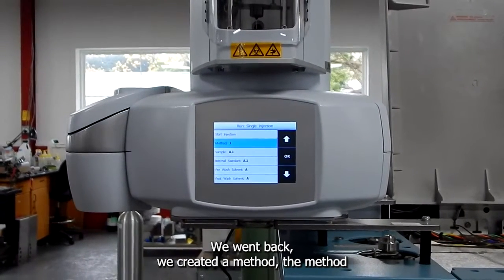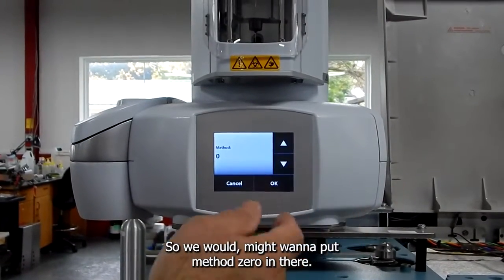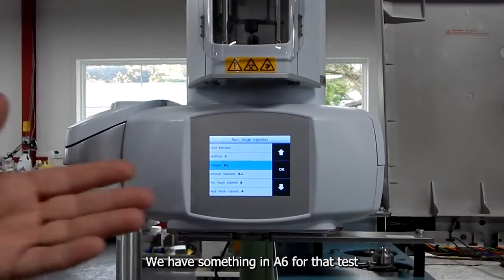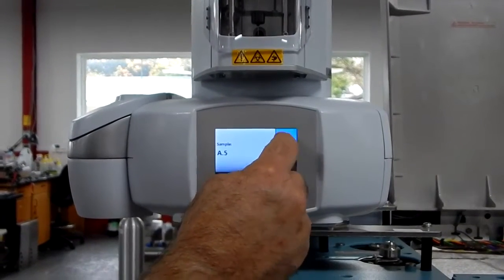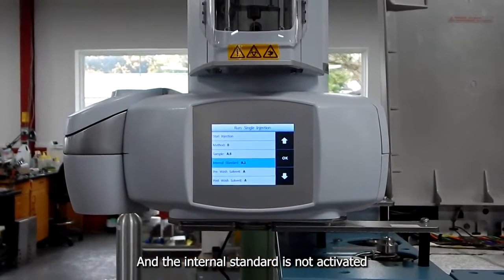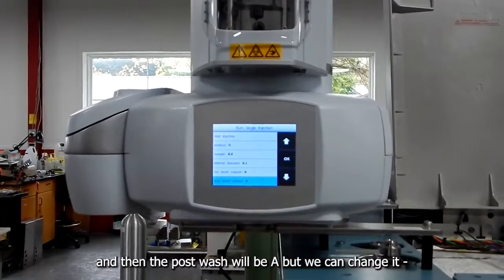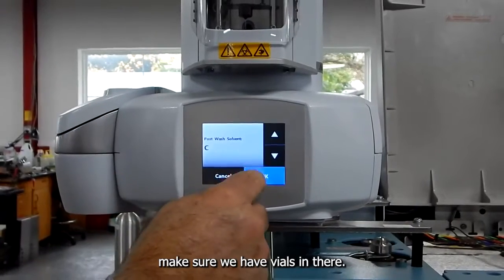We went back, we created a method. The method that I created before was method 0. So we might want to put method 0 in there. So it will go in and load that. We have something in A6 for that test, and let's just leave it in A6 so we can change where that sample is going to be. And the internal standard is not activated, and then the pre-wash will be A, and the post-wash will be A. But we can change it. We can make that B or C, as long as we make sure we have vials in there.